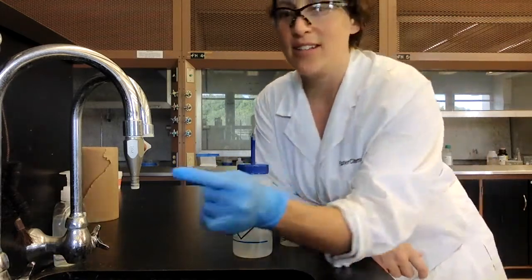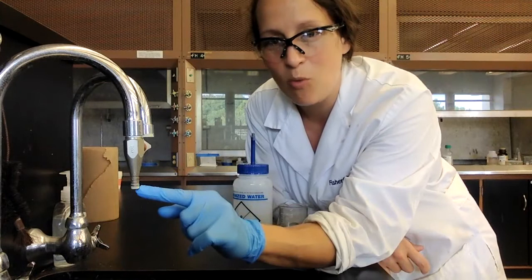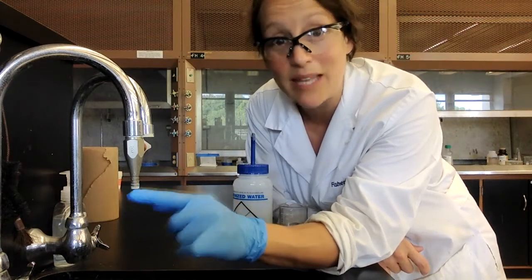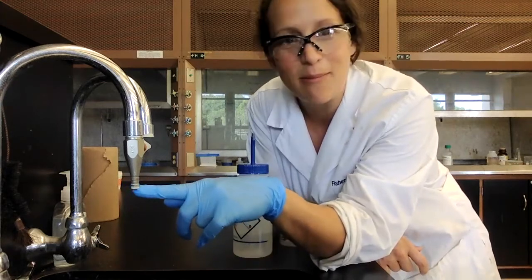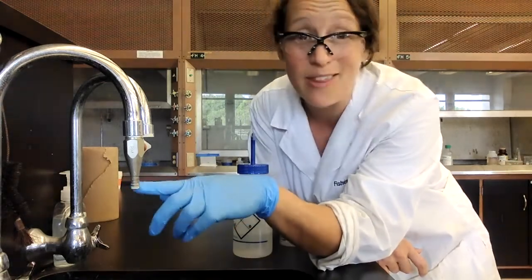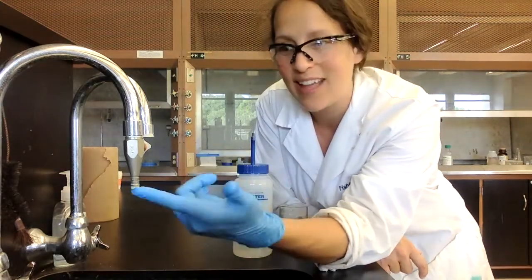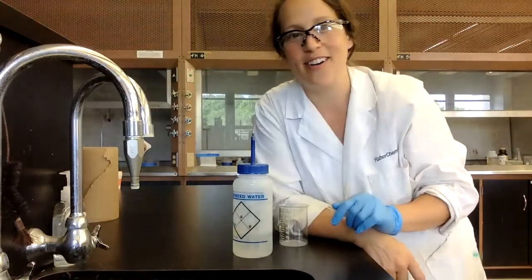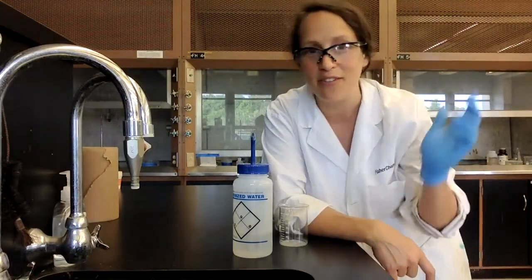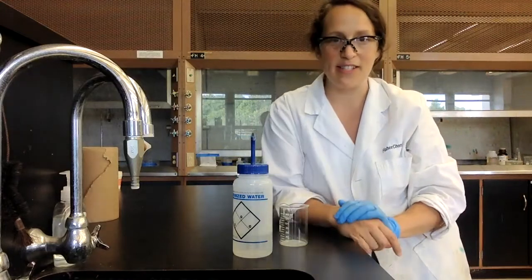The tap water, even on some of the spigots, you can see there's some white lime scale that's built up. And again, this is the hard water, so those are calcium and magnesium ions, amongst some other stuff that's in the water that has started to dry up and form solid on our faucets. And if you are at your house and you have hard water, you can see it on your faucets as well.